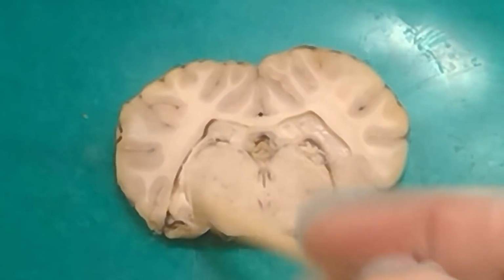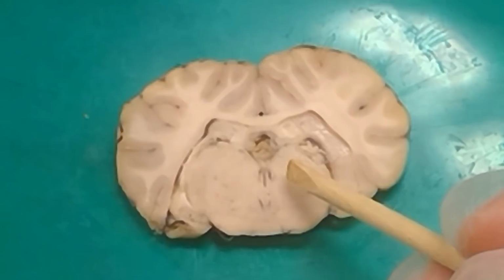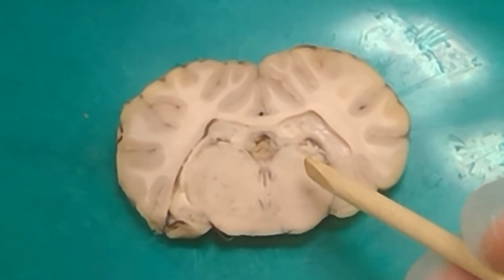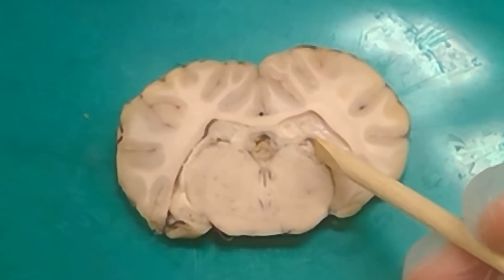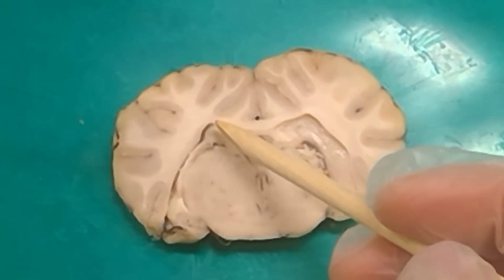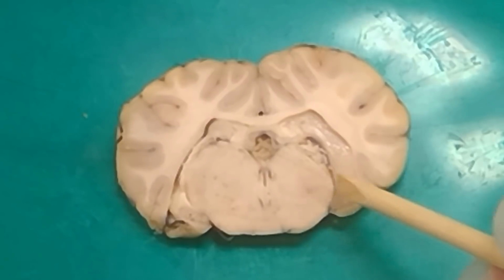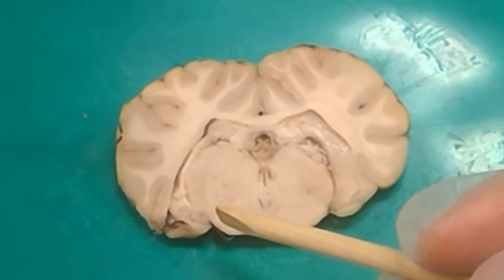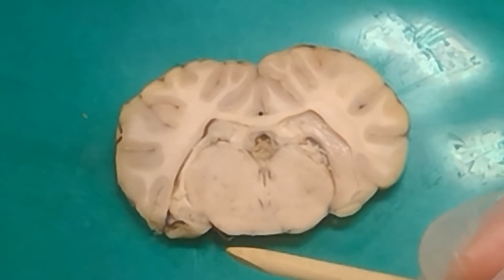So you know you're at the thalamus right here, right? This is definitely the thalamus. We're not looking at the caudate, right? And there's a pin over here to the lateral side of it. There's only one thing we've asked for that's on the lateral side, where you can see the hippocampus up here. You'll definitely be able to see hippocampus with fimbria. That's how you know you're at the distance back where the LGN would be.